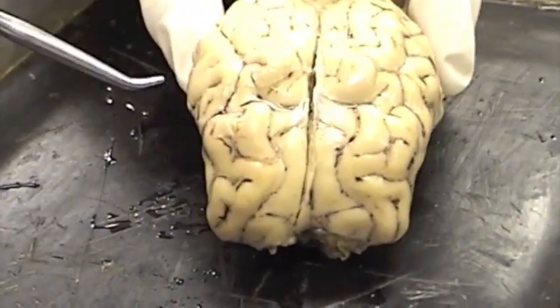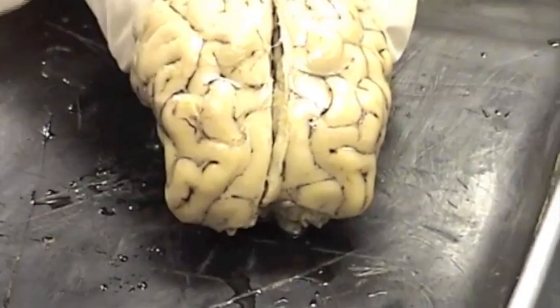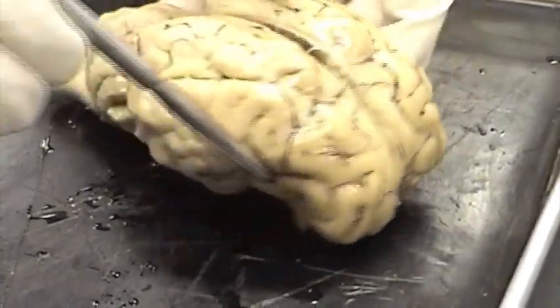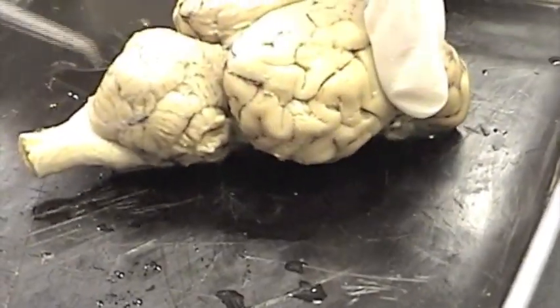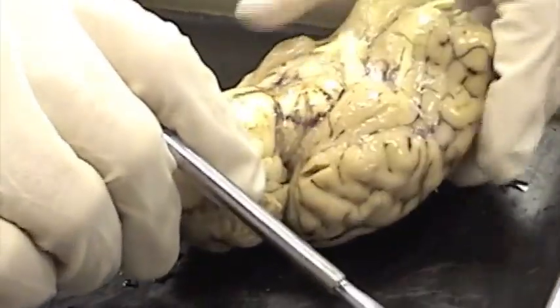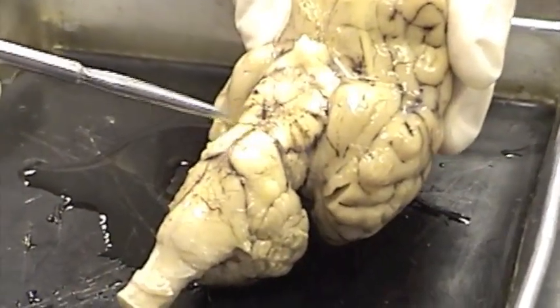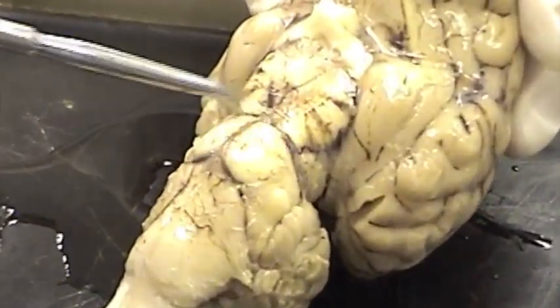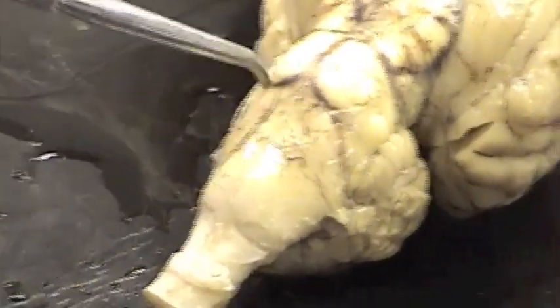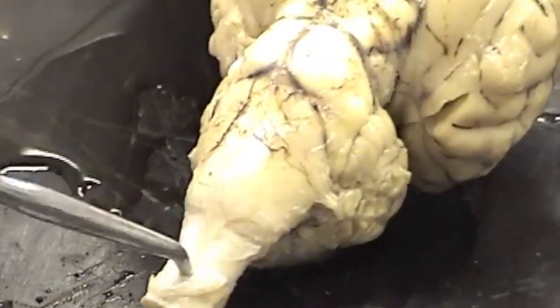We have some general regions of this brain you're responsible for. One is the cerebrum — all of this here is cerebrum. Back here we have the cerebellum. If I turn the brain on the ventral side we can see some other general regions: here is the pons and here is the medulla oblongata, and then we're down into spinal cord.